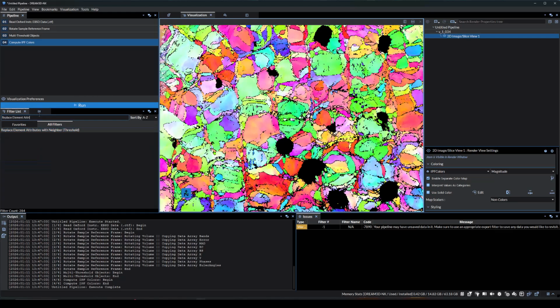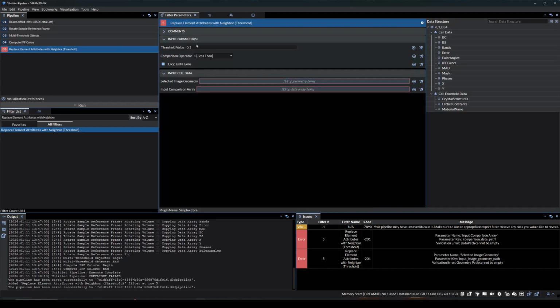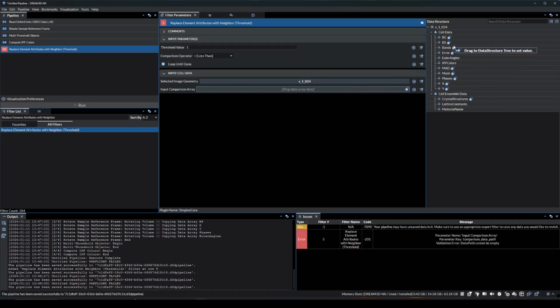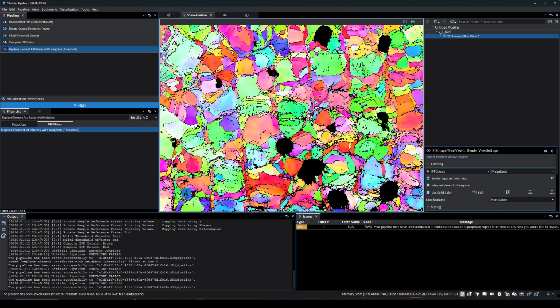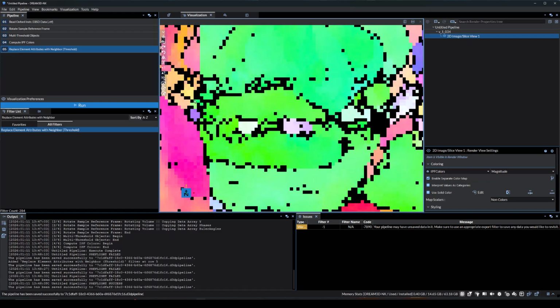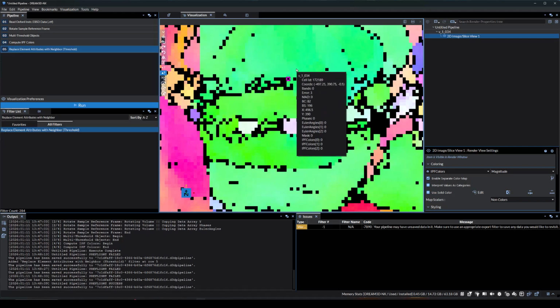Let's add the Replace Element attributes with Neighbor filter. Here, we will change the threshold value to 0.1, then fill in the paths for the input cell data parameters. Quick note, you can right-click a filter in the pipeline and click Filter Help. This will bring up the filter documentation on our website. Another note, enabling the hover cells on option in the visualization will allow you to view individual cells in the data just by hovering over them.